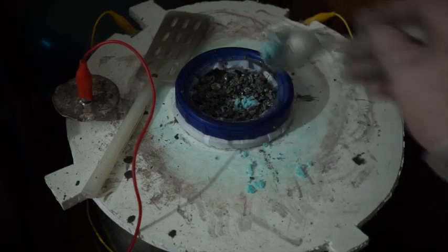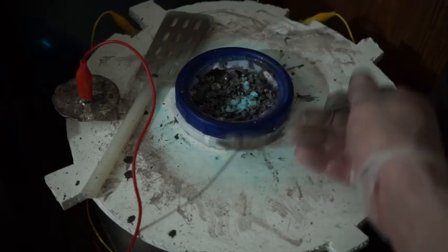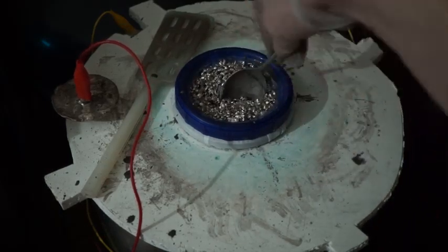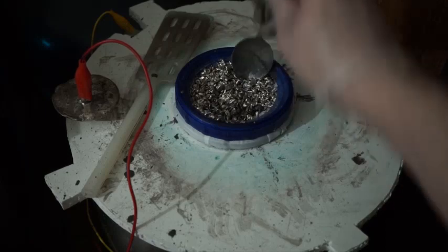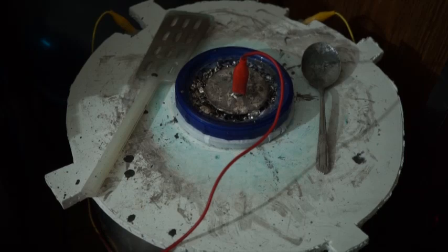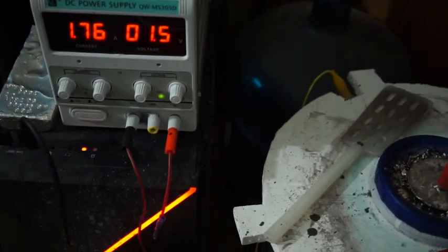Scoop the contaminated nitrate crystals back into the anode basket. I will top off the anode basket with some more silver shot. I will place my anode on the top of the pile. As I said before, silver is one of the best conductors of electricity, so there is no need to bury it and risk eroding your pure silver anode. It looks like I have solved the issue — the current has returned to 1.75.